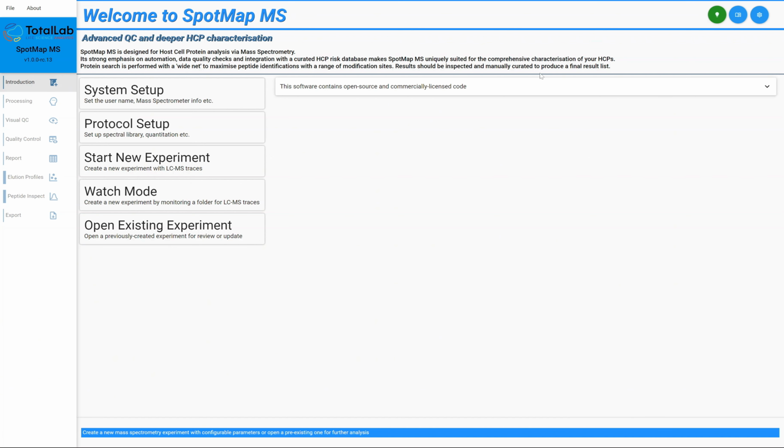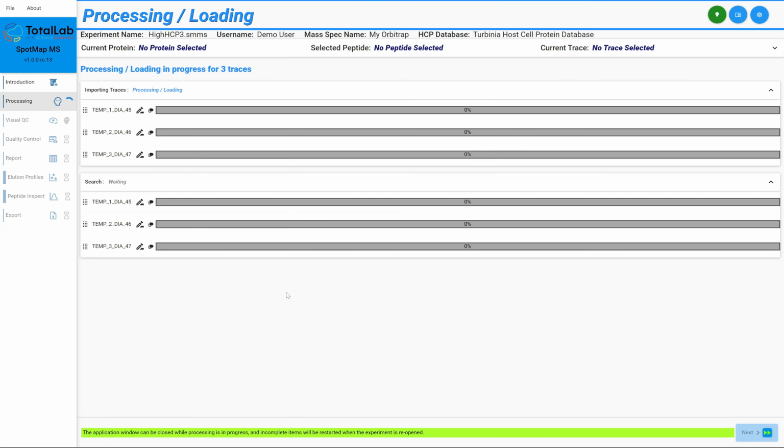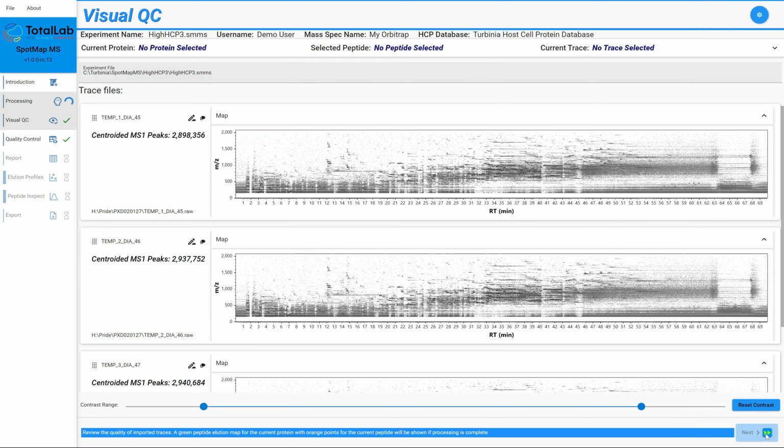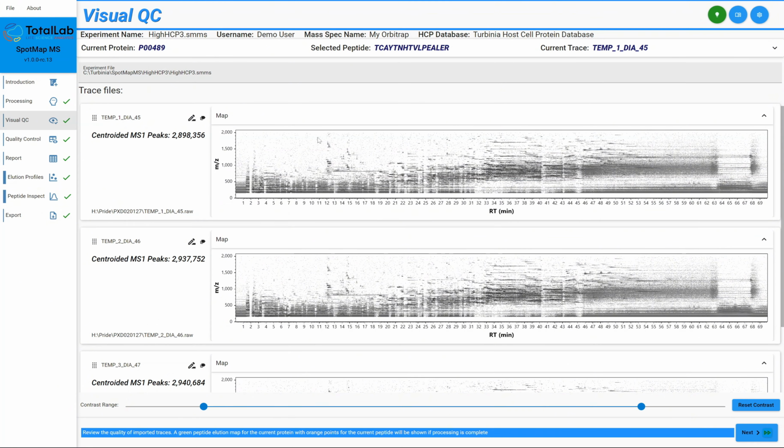I'm just going to open an existing experiment, a little demo experiment that we've got built directly into the software. Here the software is processing, it's loading the raw trace files in. The first thing we show users whilst it's still processing the data is the visual QC, as soon as we can. So this is what the visual QC section of the software looks like.